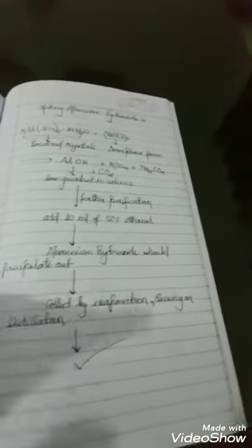It's just potassium aluminum sulfate bonded with some dihydrogen oxide, which is water. Next up you need some sodium bicarbonate, which is baking soda.